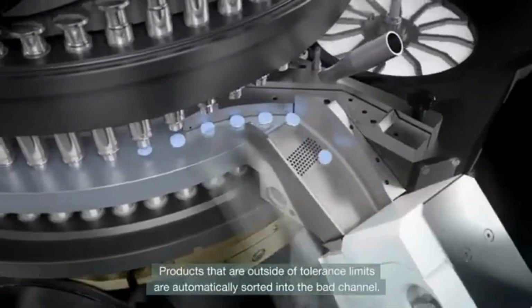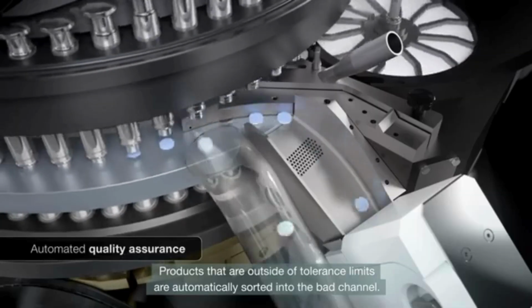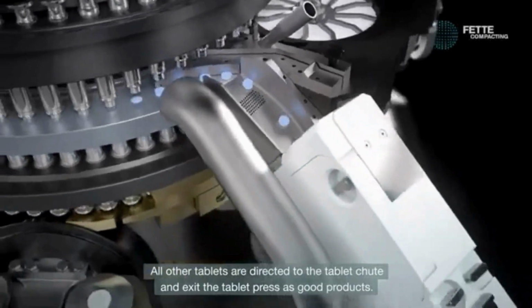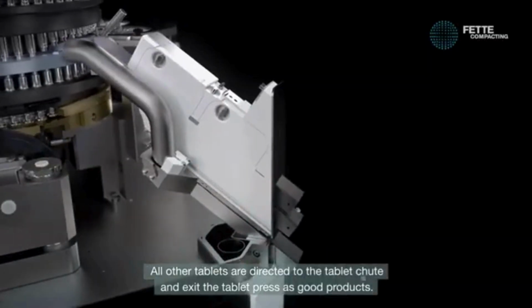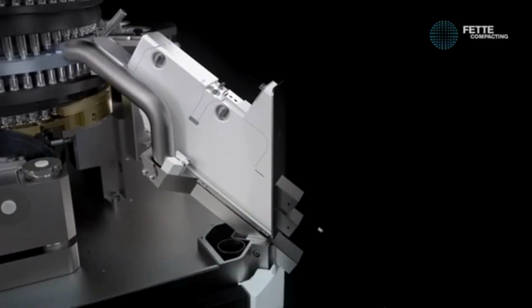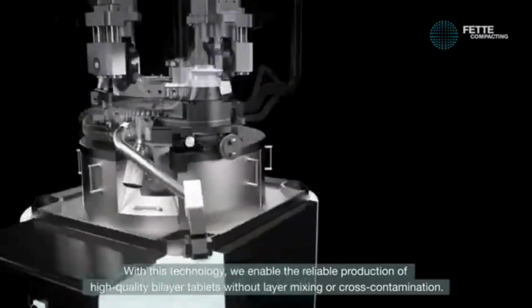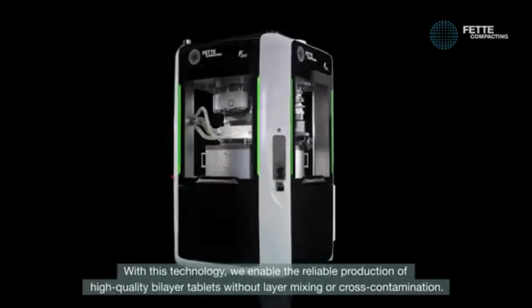Products that are outside of tolerance limits are automatically sorted into the bad channel. All other tablets are directed to the tablet chute and exit the tablet press as good products. With this technology, we enable the reliable production of high-quality bilayer tablets without layer mixing or cross-contamination.